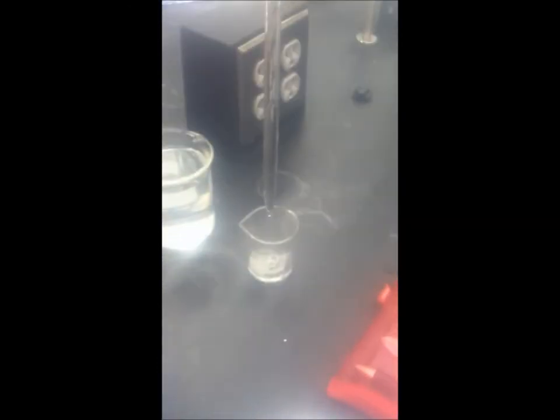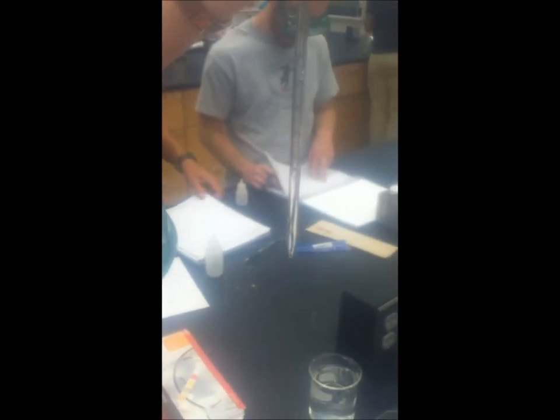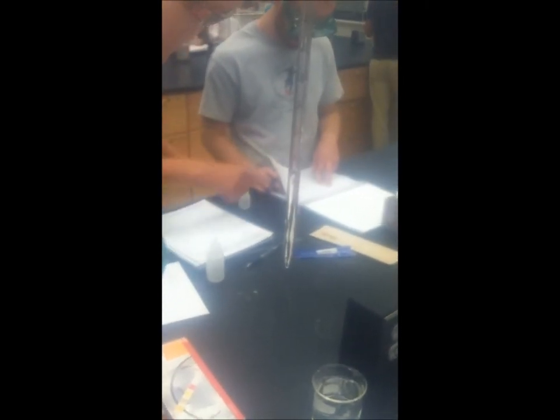After recording her first measurement, Carly will then empty an unknown amount of water into the second beaker and get a second measurement. She will then record this measurement in the final volume spot of her chart.